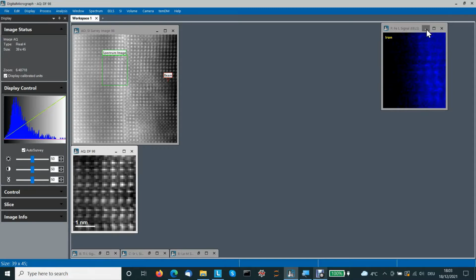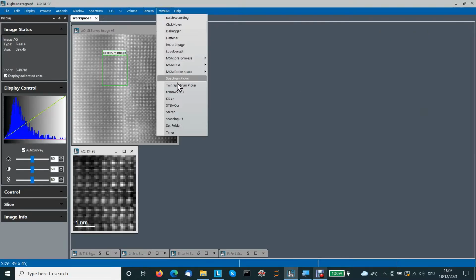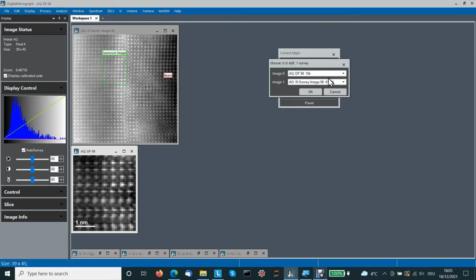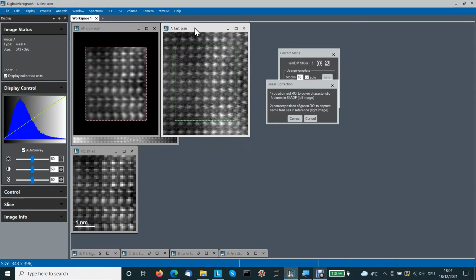Let's minimize the maps temporarily and open a new tool, which is called SICor. Here we are. Then we click on the survey image and on the in situ dark field image and press tune. Then we have to confirm the sequence of the images. Image 0 dark field, image 1 survey. Okay. Now we have a kind of twin image.